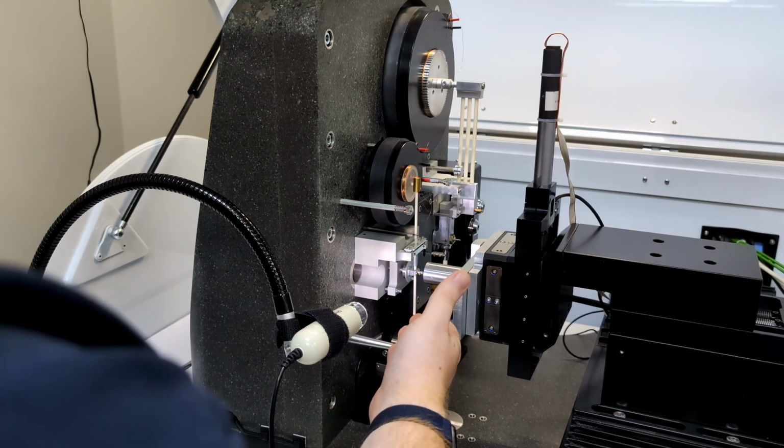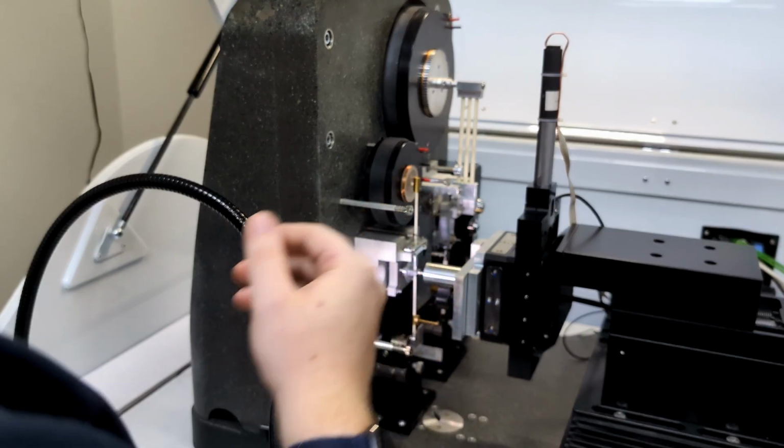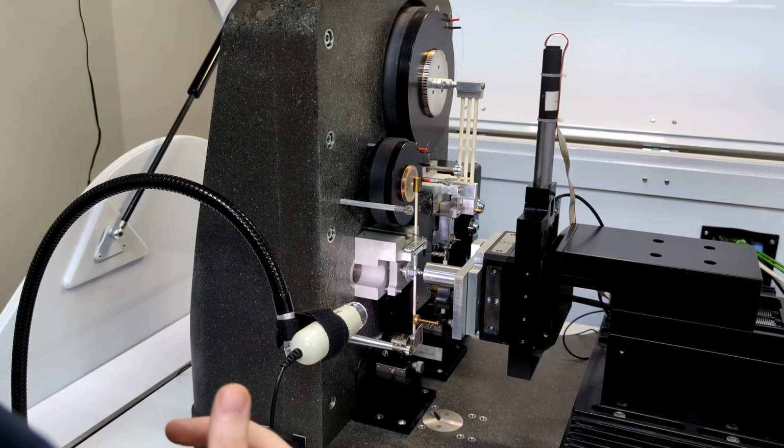The nano loading head, seen here at the front, can achieve static impact loads of 100 millinewtons and 5 newtons with a micro loading head at the rear. The final impact force will be higher and depends on other parameters such as the accelerating distance, which can be up to 24 microns for nano impact and 70 microns for micro impact. This high energy density accelerated fatigue test is capable of fracturing all types of hard, wear resistant coatings up to around 5 microns in thickness.